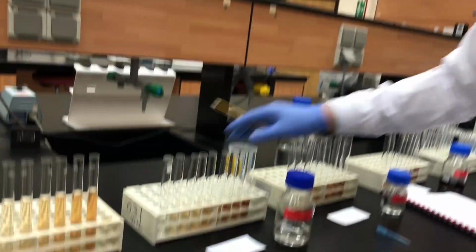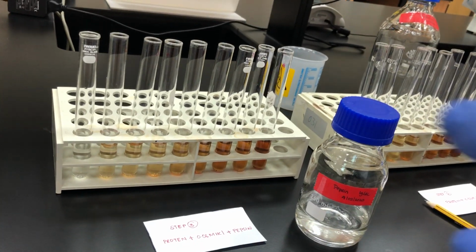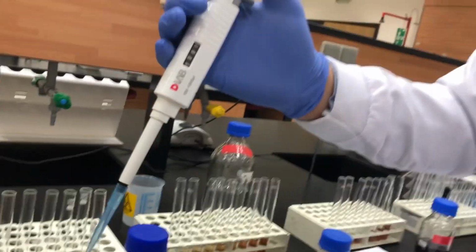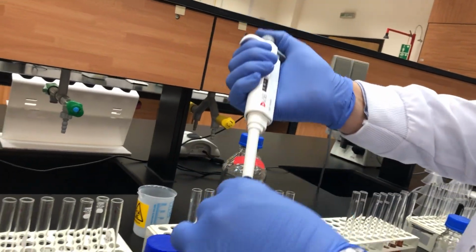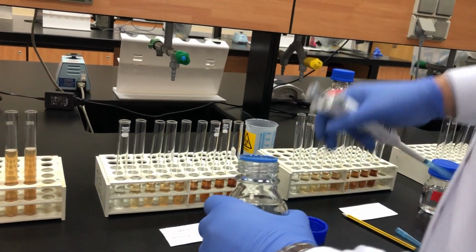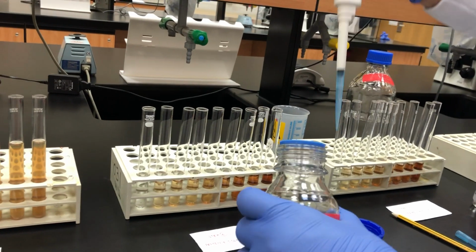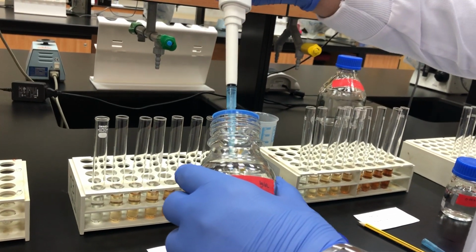So now we will start adding the pepsin. Here I have the tubes, arranged for 1 ml. For 1 ml, now I will start adding the pepsin. When I start adding the pepsin, please put your timer on and start. Okay? So now I start step number 1.